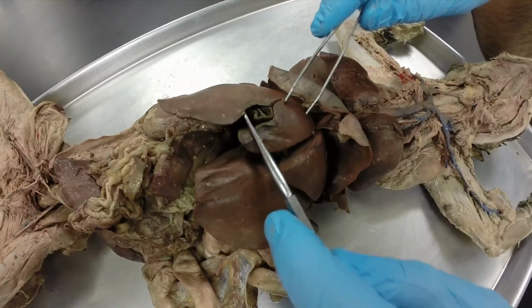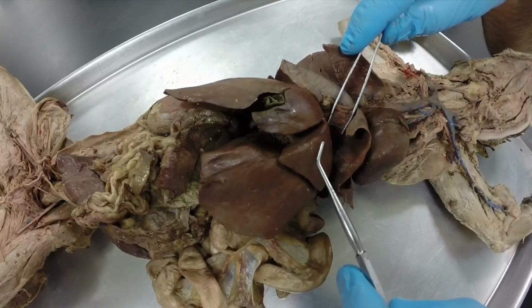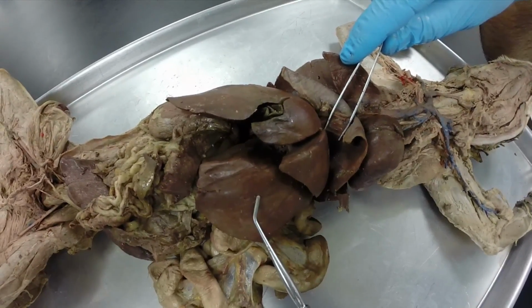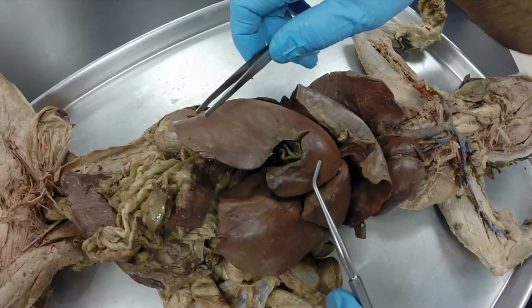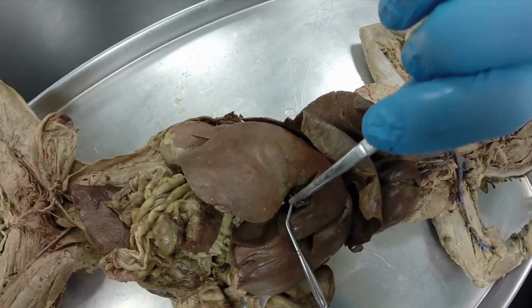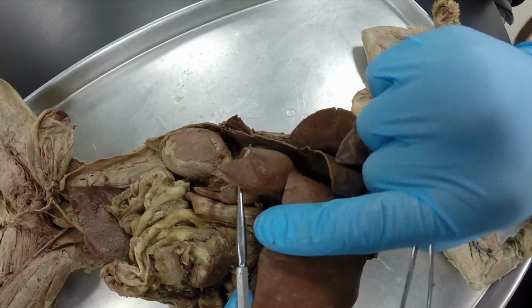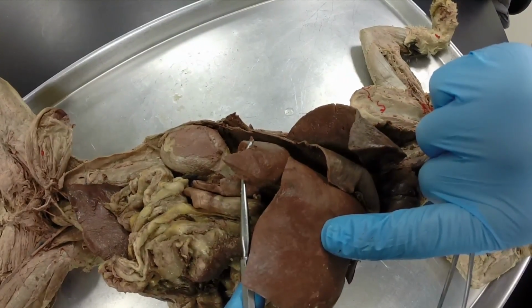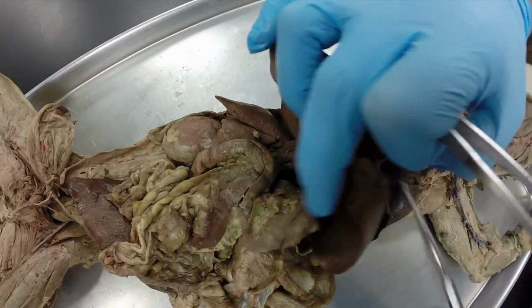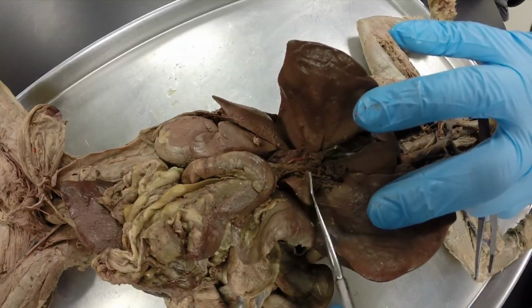This is the liver. It's broken down into lobes based on the left and right side. So this would be our left medial lobe. This would be our right lateral lobe, or this would be our left lateral lobe. This large lobe right here is our right medial lobe, and it contains the gallbladder, which is this little green pouch right there. Now this is kind of confusing, but this is our right lateral lobe. So don't let that confuse you. This is all one large lobe on the right side. Then if we look inside here a little bit, we can see our caudate lobe right there, caudate lobe of the liver.